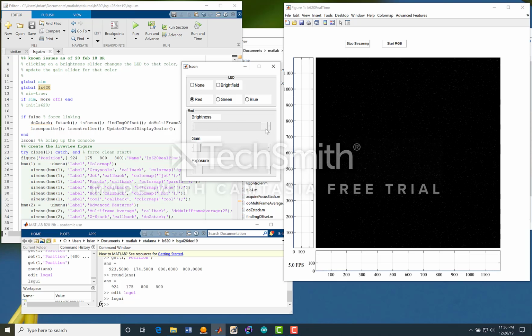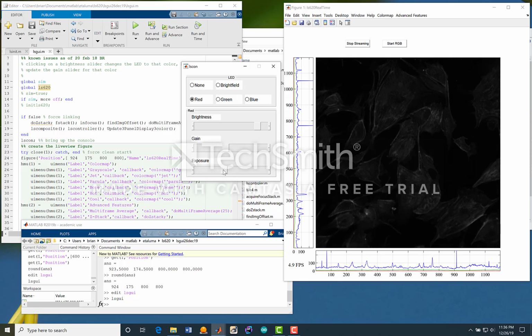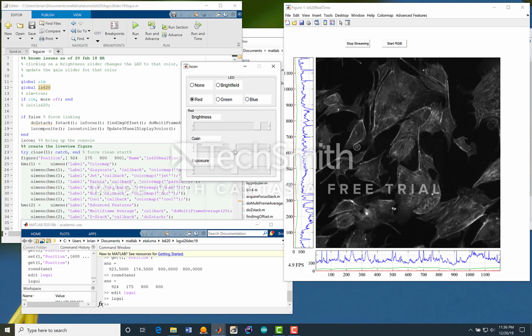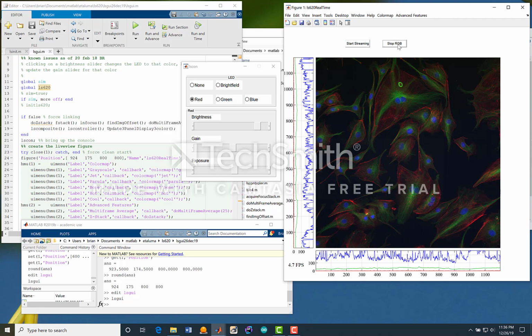Let's switch to red. I know that LED wants to be up there. We're going to need some serious gain probably, and also a bit of exposure in order to get some nice images here. And maybe I can focus that a tad better. Okay, so you want to see what some RGBs look like? Let's stop the streaming, and we'll take some RGB images.